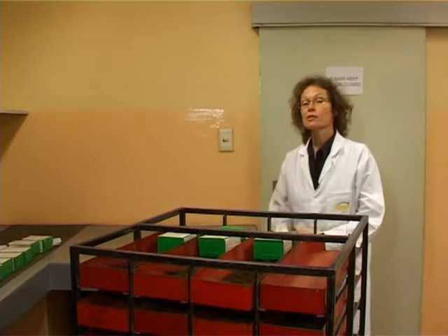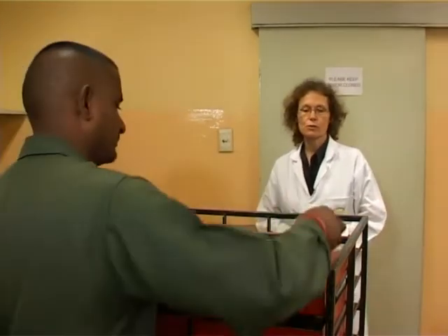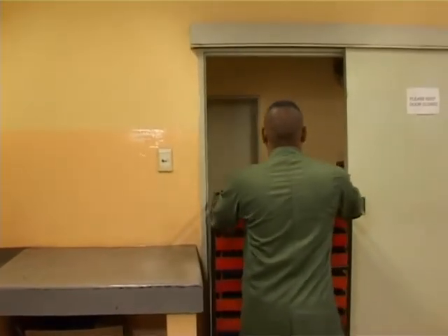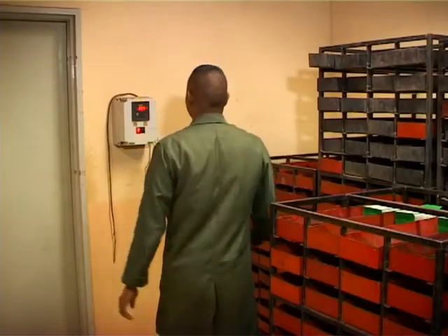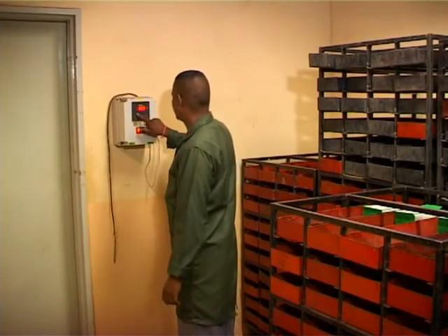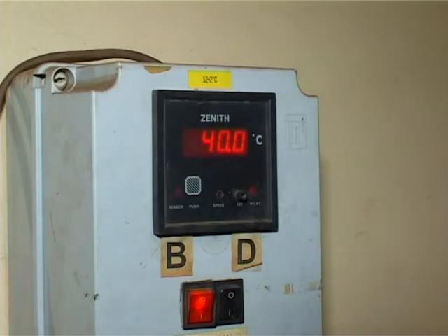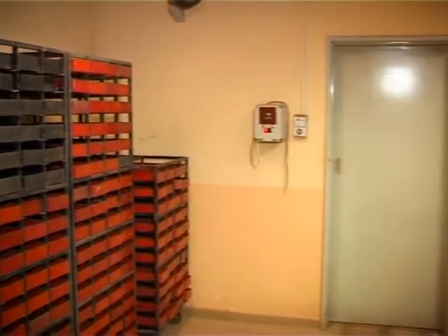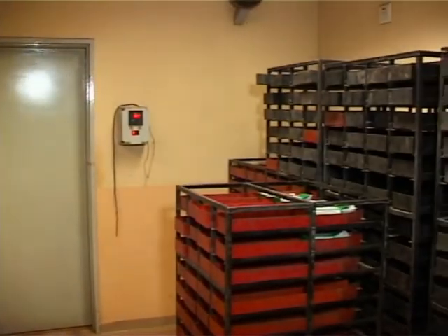Once registered, the samples are emptied into drying trays and taken through to the drying room. Here the samples are dried overnight at a temperature of 40 degrees Celsius. This removes all the moisture to eliminate any influence on the analysis results. We've doubled the capacity of the drying room so that we can process more samples daily.